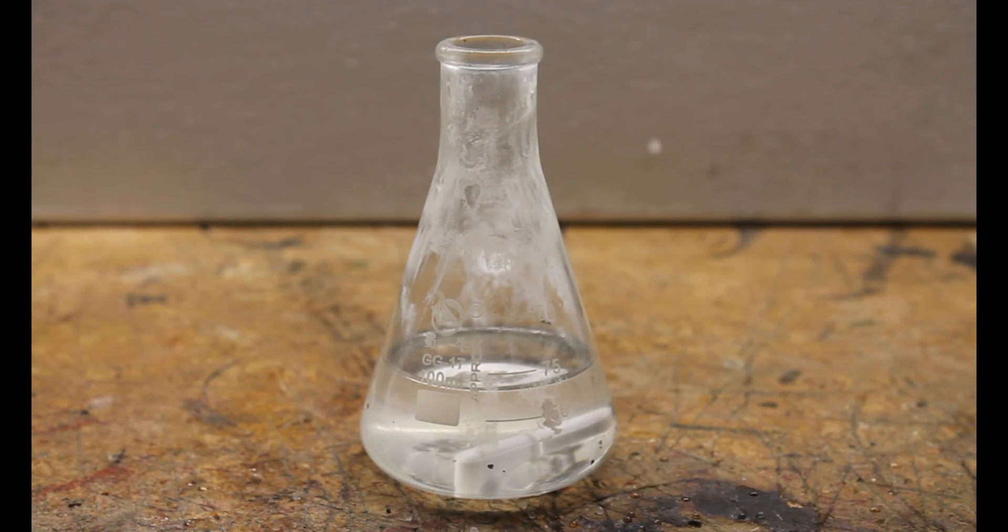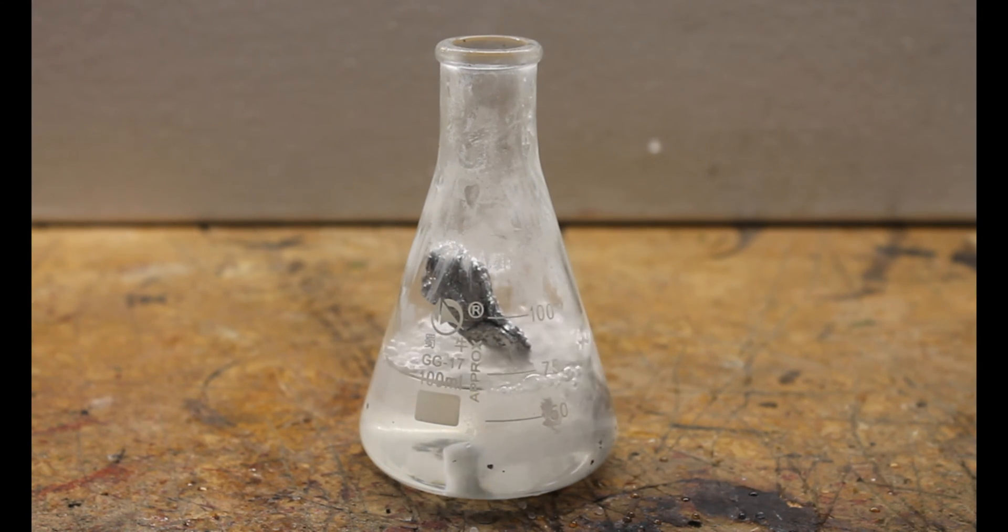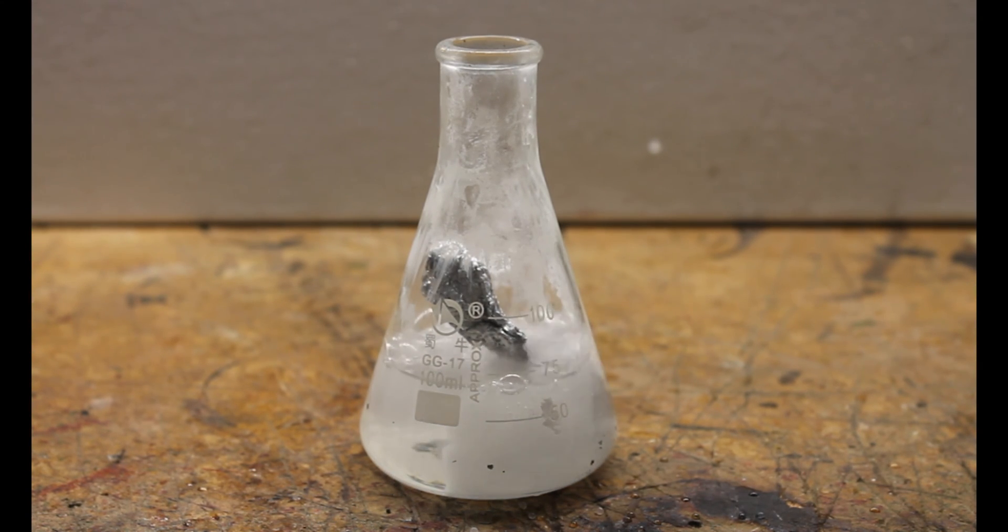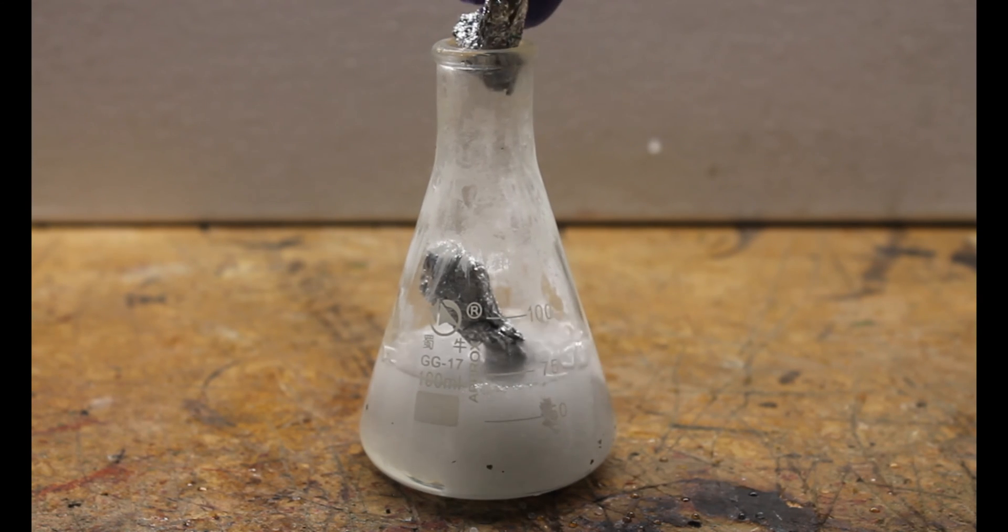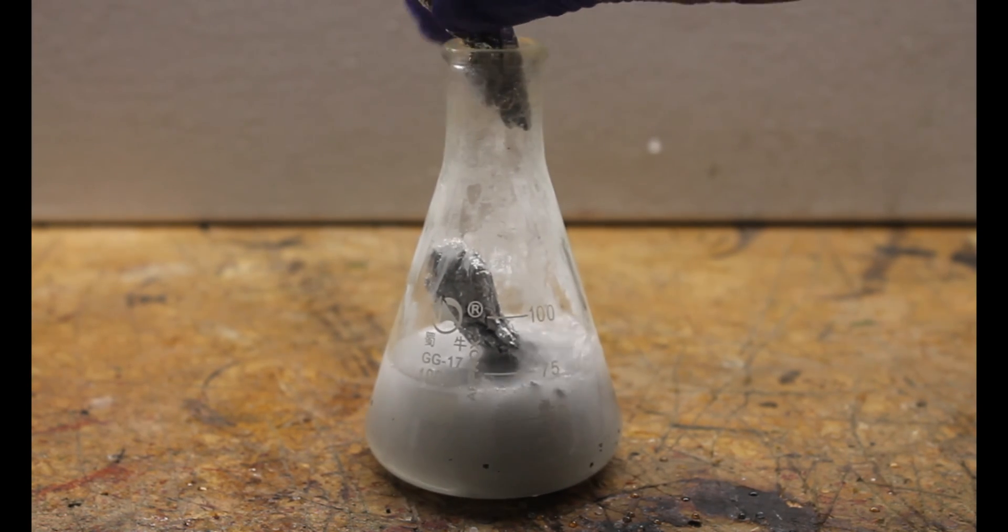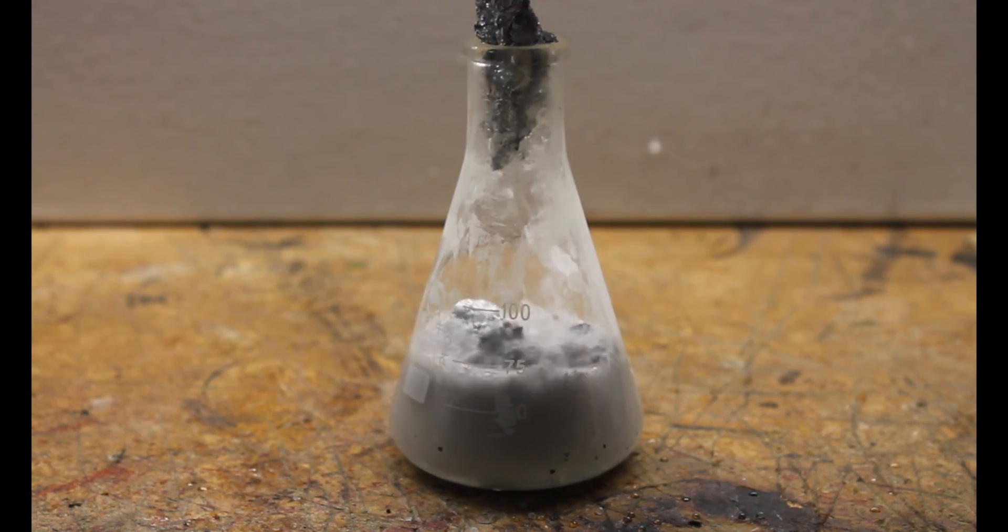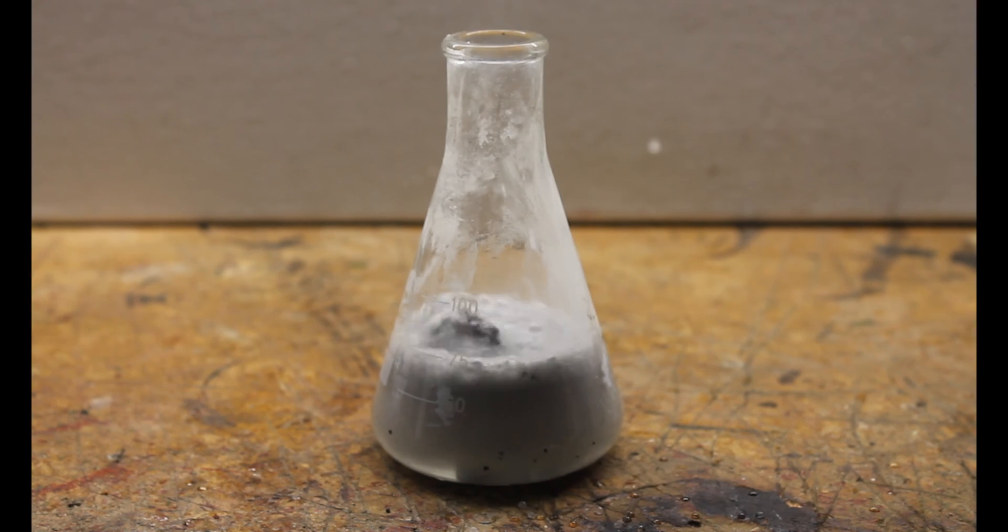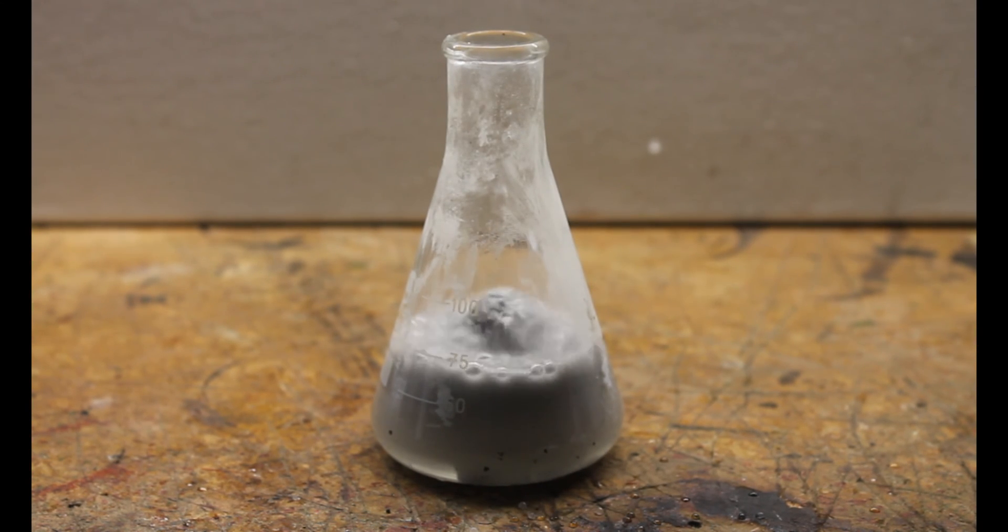But as we move on to the demonstration we add some aluminium foil to our concentrated solution. I almost added more aluminium but thought better of it when seeing just how fast this reaction was taking place.